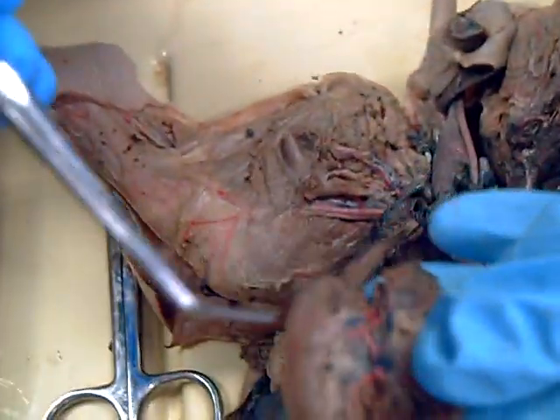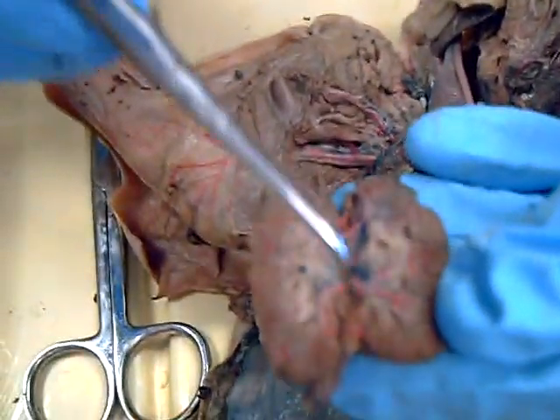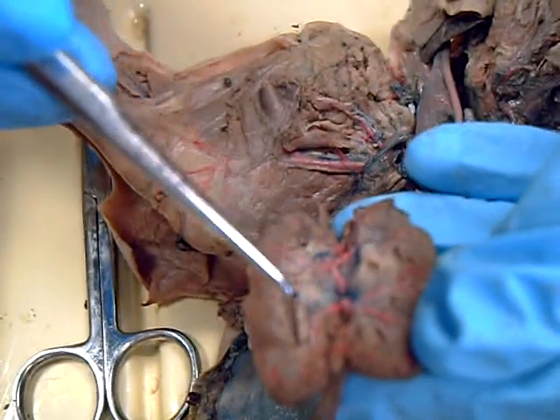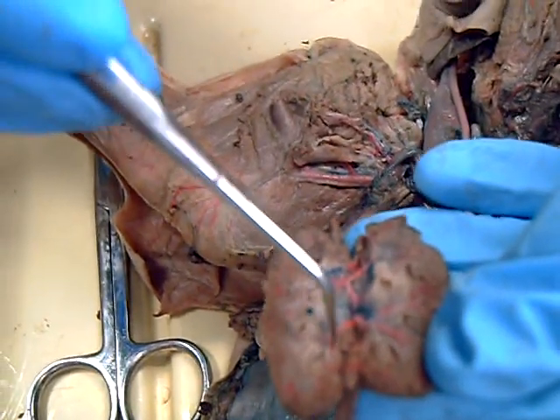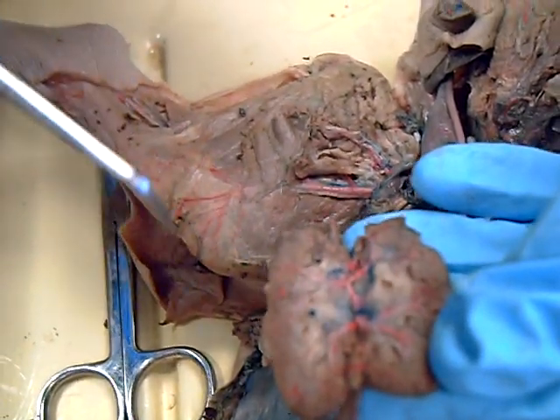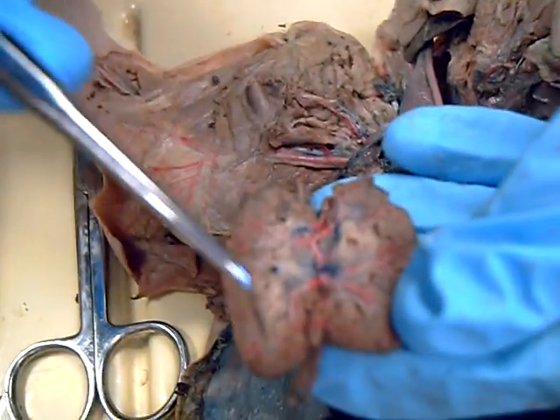Open it up. There should be like triangular regions, like right in here. And those are called renal pyramids.